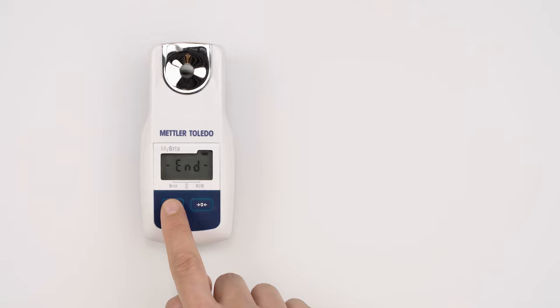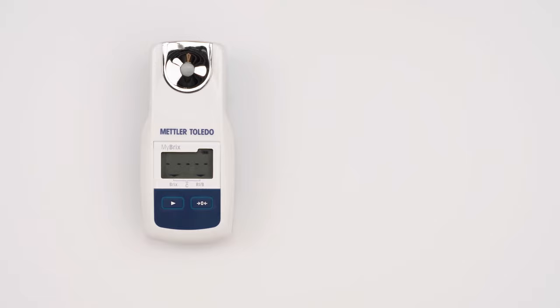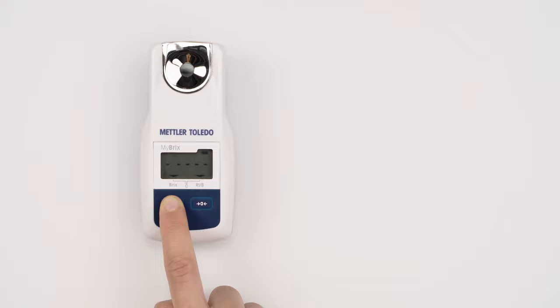Hold the zero key and press the read key to pre-select the active scale for the next measurement. You can choose between Brix, refractive index, or scale B and scale C, which are indicated by the arrow. Now you are ready to measure your sample.